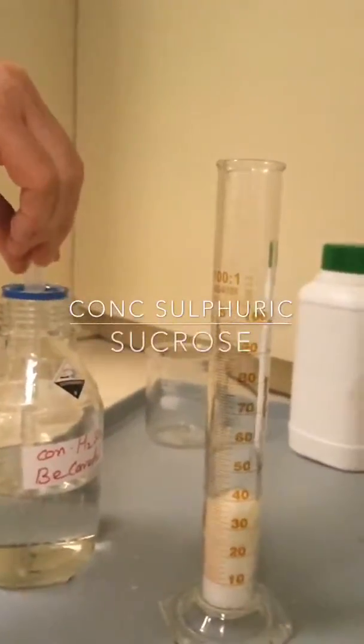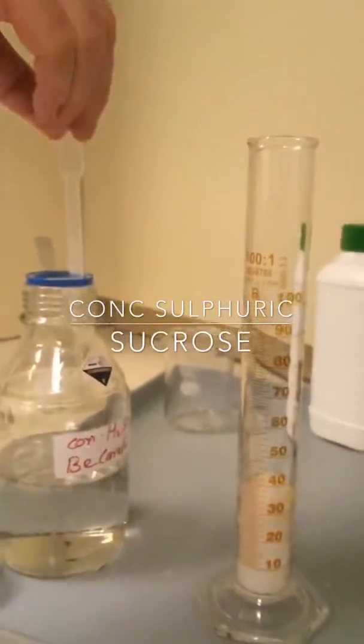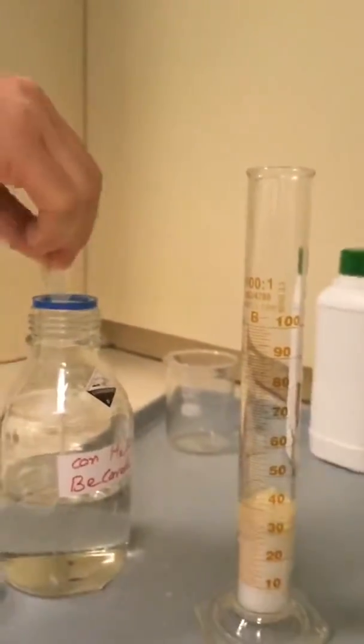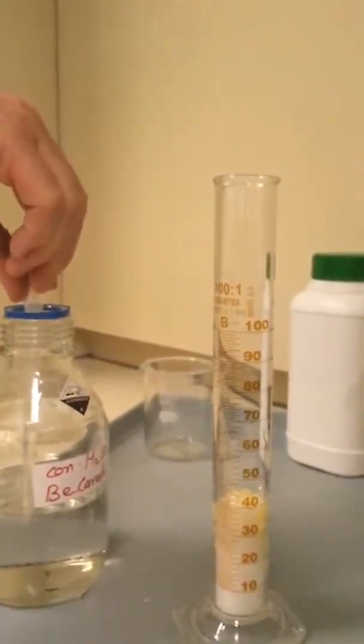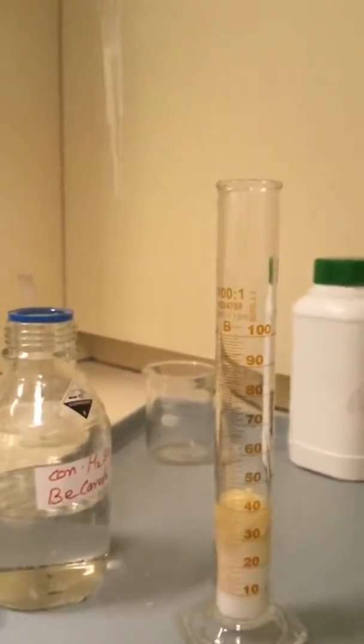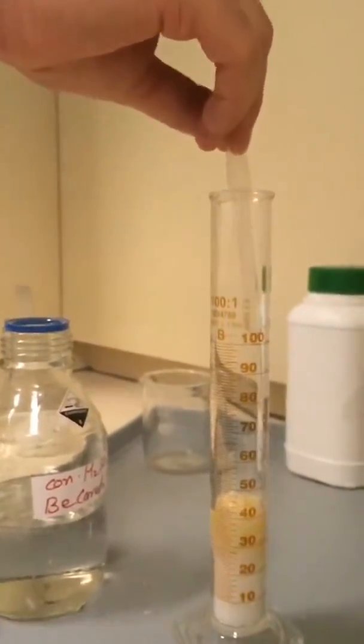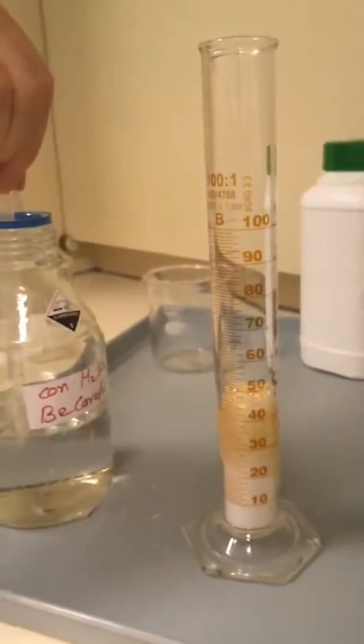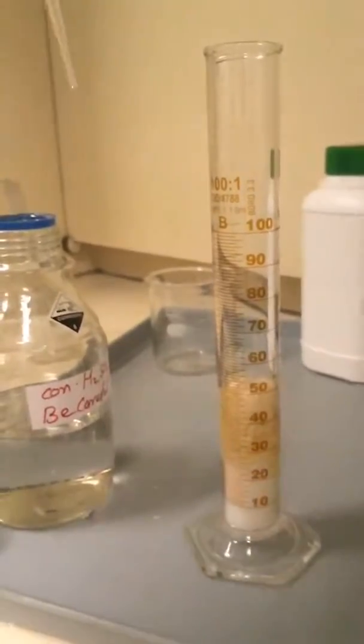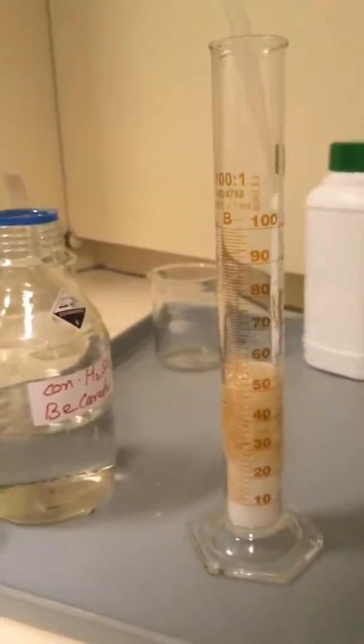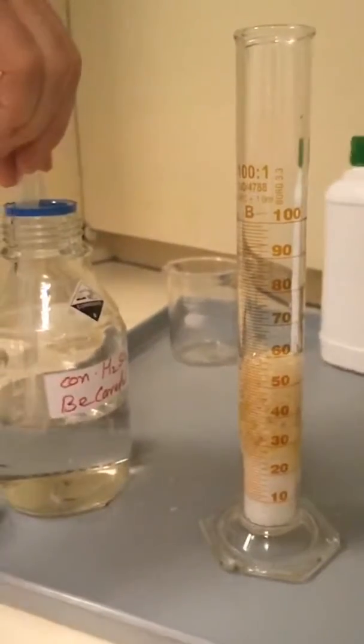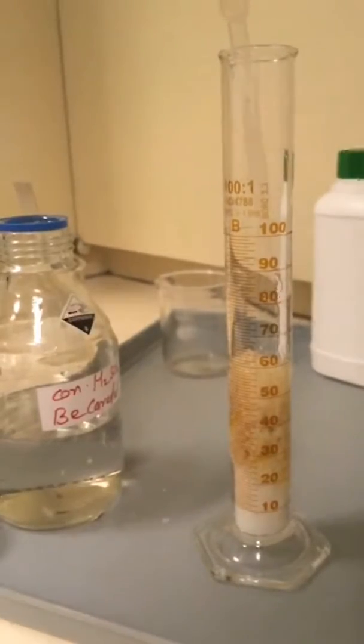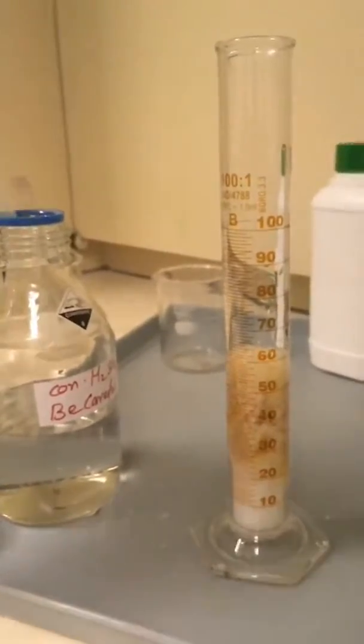Concentrated sulfuric acid. When it hits the sugar, very little happens. And if you get concentrated sulfuric acid onto your skin, nothing will happen for about 10 seconds. And then the concentrated sulfuric acid will start to react with your skin, of which sugar is the model. There's a lot of respect for this chemical.